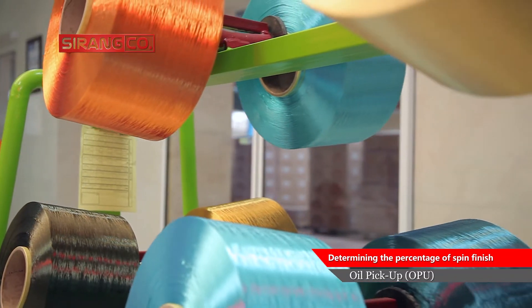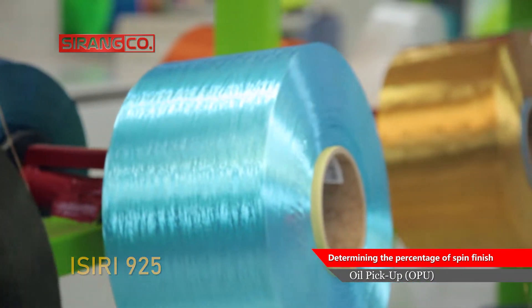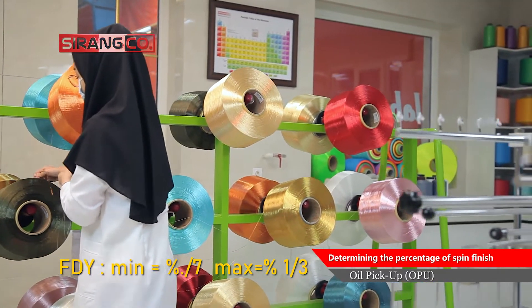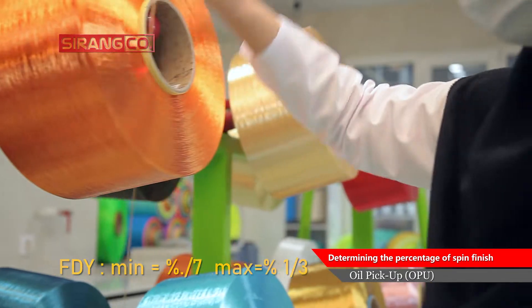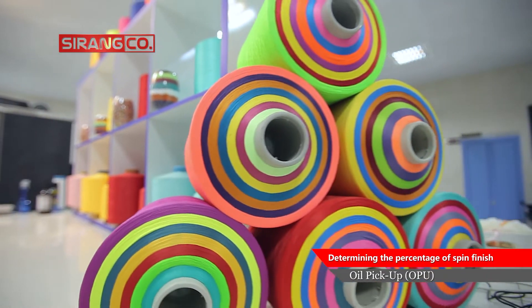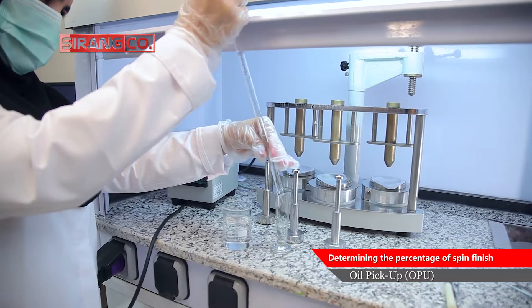For example, according to the Iranian National Standard No. 925, the acceptable range of oil percentage for FDY yarn is between 0.7 up to 1.3%. Therefore, due to the importance of the allowable amount of oil in the yarn, it is necessary to provide a method to determine the percentage of spin finish oil in the yarn.